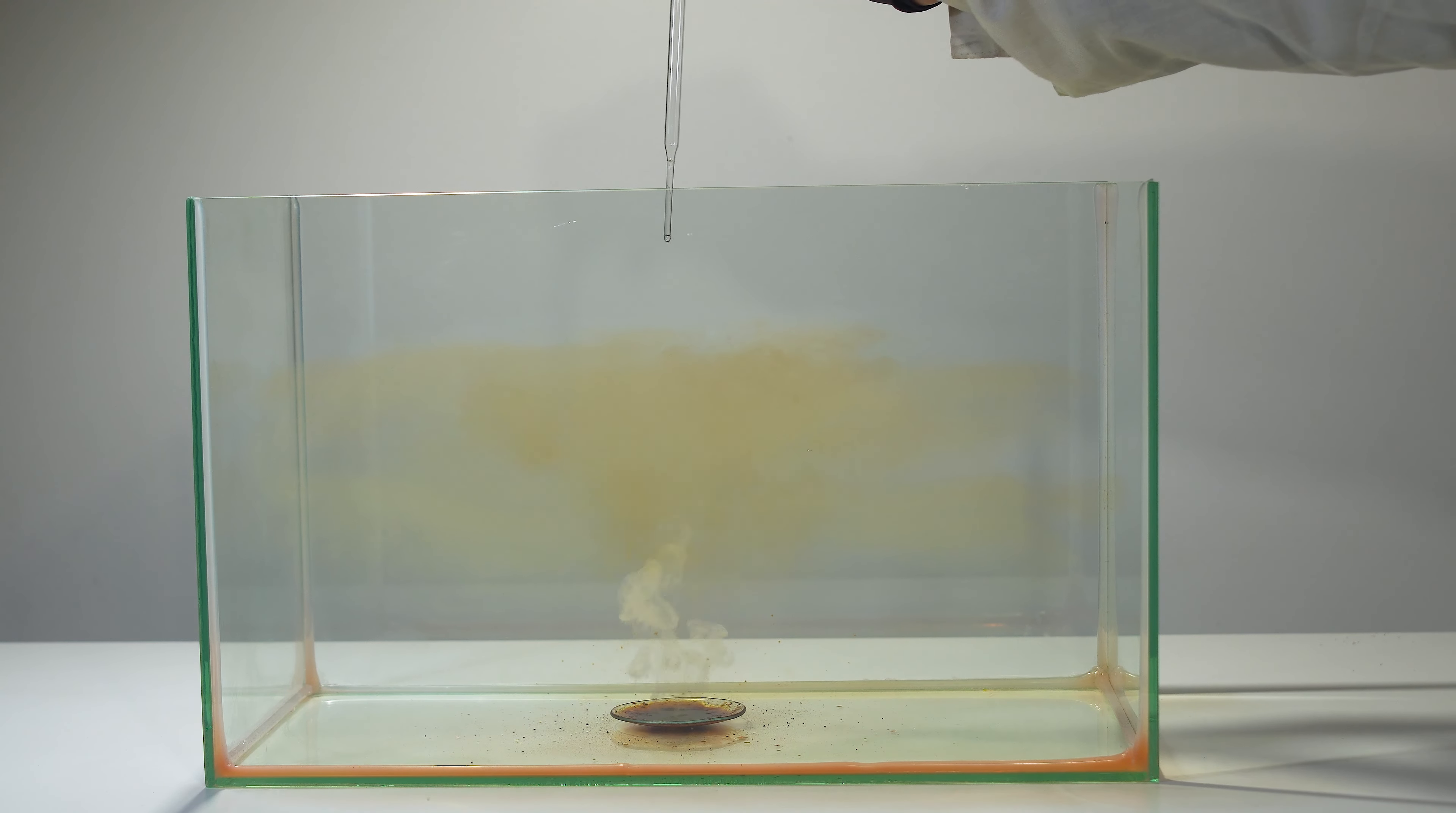Due to the absence of oxygen, a mushroom cloud does not combust, and unoxidized reaction products keep floating in the glass box.